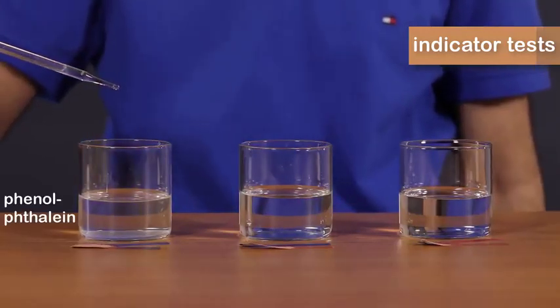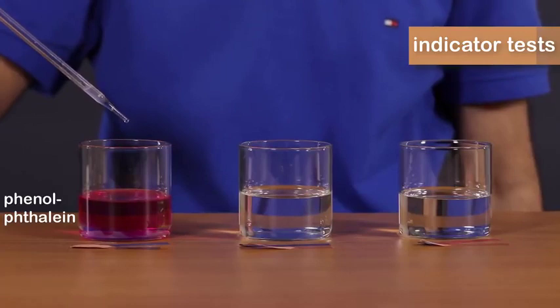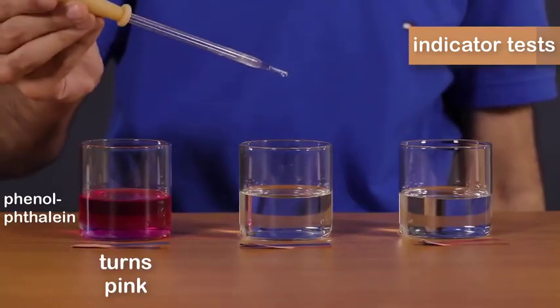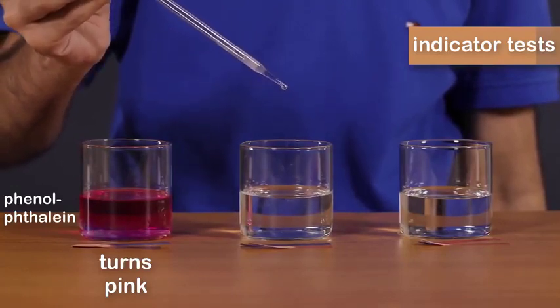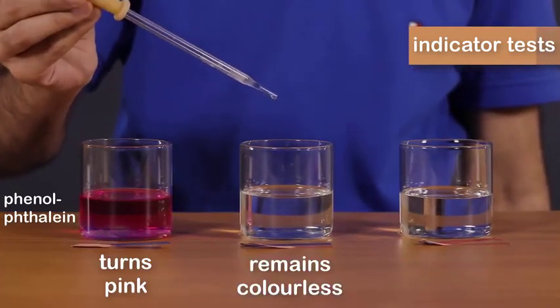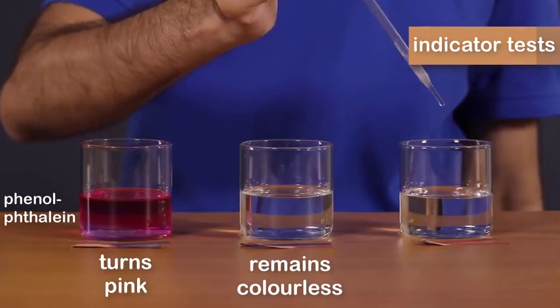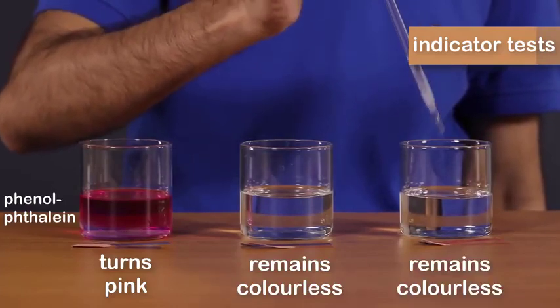Now let's add the phenolphthalein indicator to the first solution. And as you can see, the color turns pink. Now let's add this indicator to the second solution. As you can see, it remains colorless. Now let's add it to the third solution. Again, the solution remains colorless.